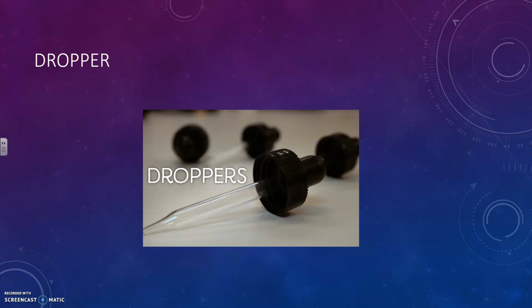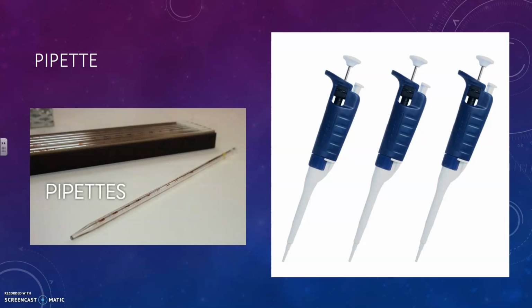Droppers, these are obviously great for moving small amounts of liquid, especially if you need just a couple drops of something. Pipettes, the type of pipettes that we would see in this class are generally more like this, or they look something like a dropper.